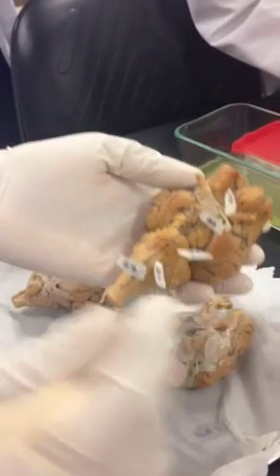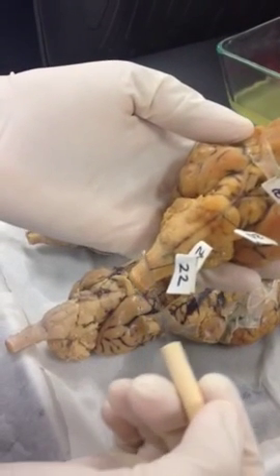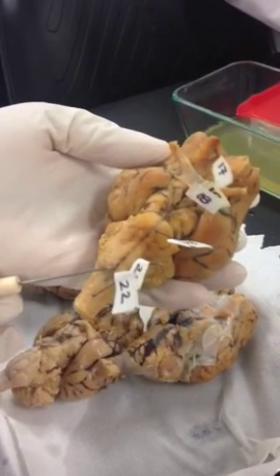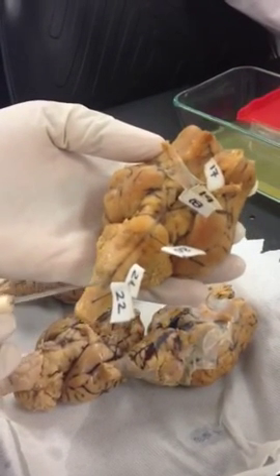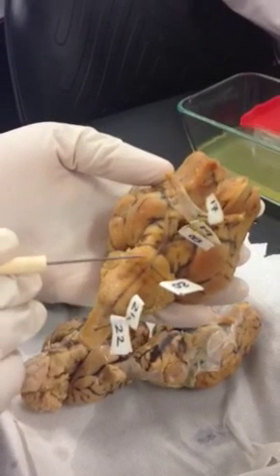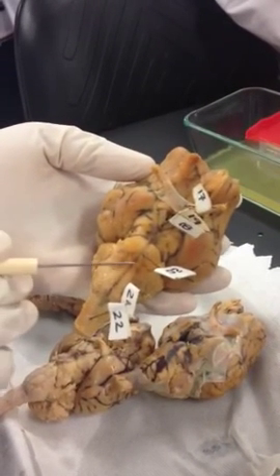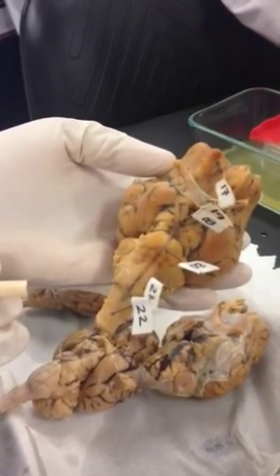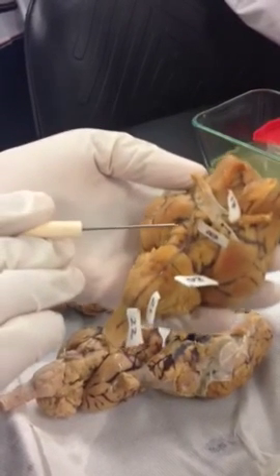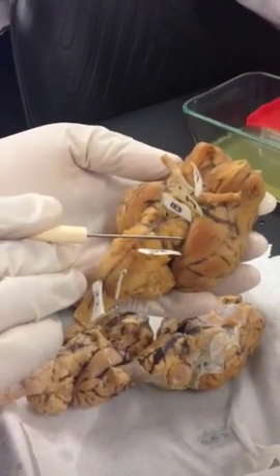Okay. Then if you see the lower portion of the brain, here you have the spinal cord at the very tip. This is the stem of the brain, the medulla oblongata, and this is the pons where you see the next bump. So you can see one bump, another bump, right? The first one is your medulla oblongata, then you have the pons, and above that we have what we call cerebral peduncle.